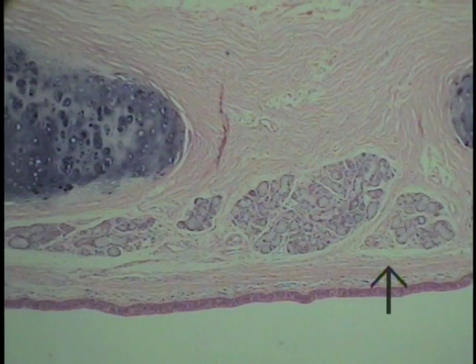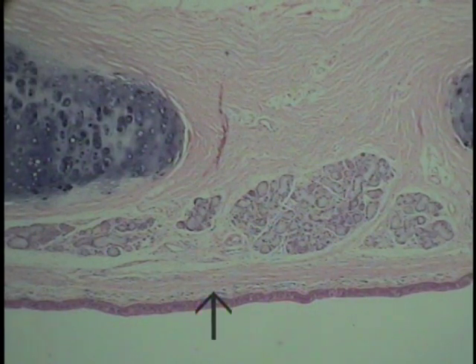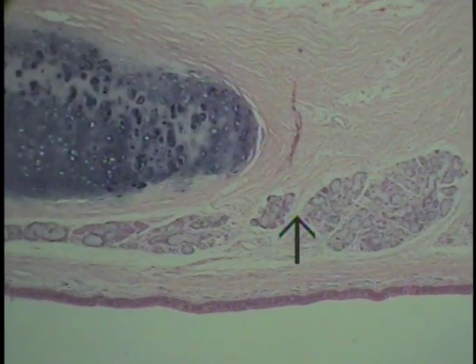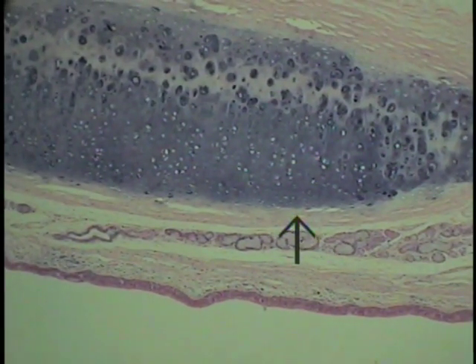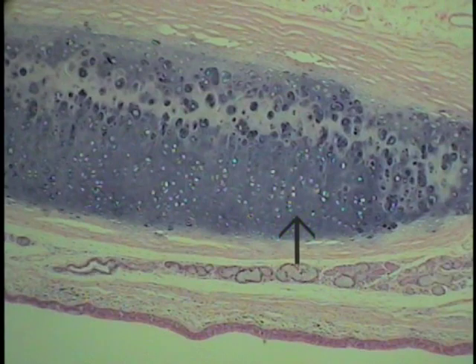Others, to create a similarity with the gut, refer to this as the lamina propria as it was described to you, and even if the muscle isn't present, the position of the glands sort of indicate the region of the submucosa. So these are the most important features of the trachea, this large conducting portion of the respiratory system.